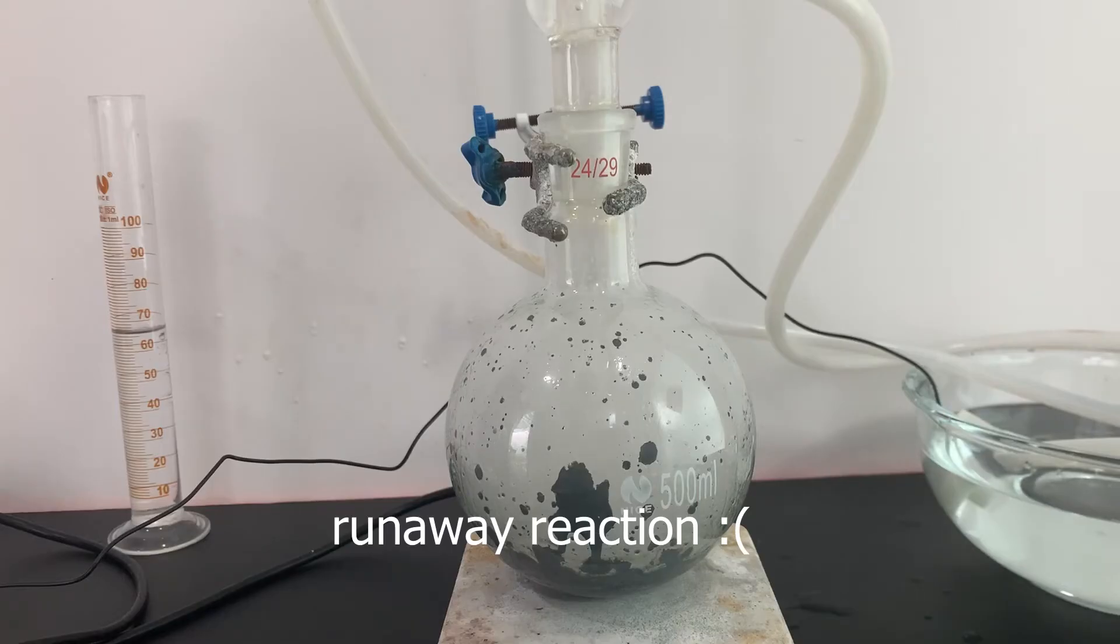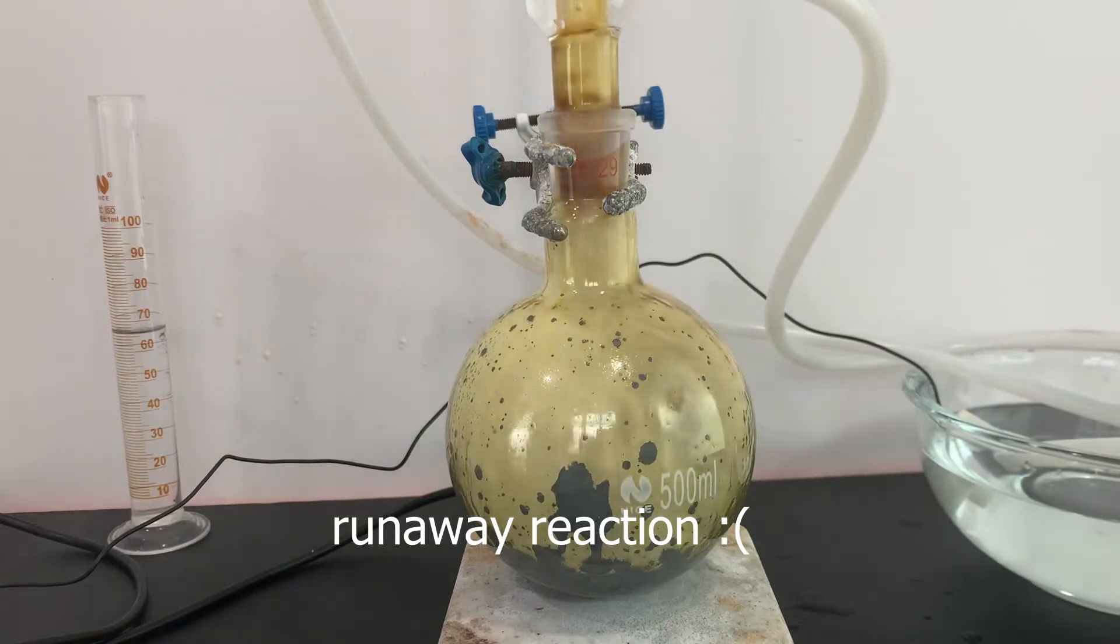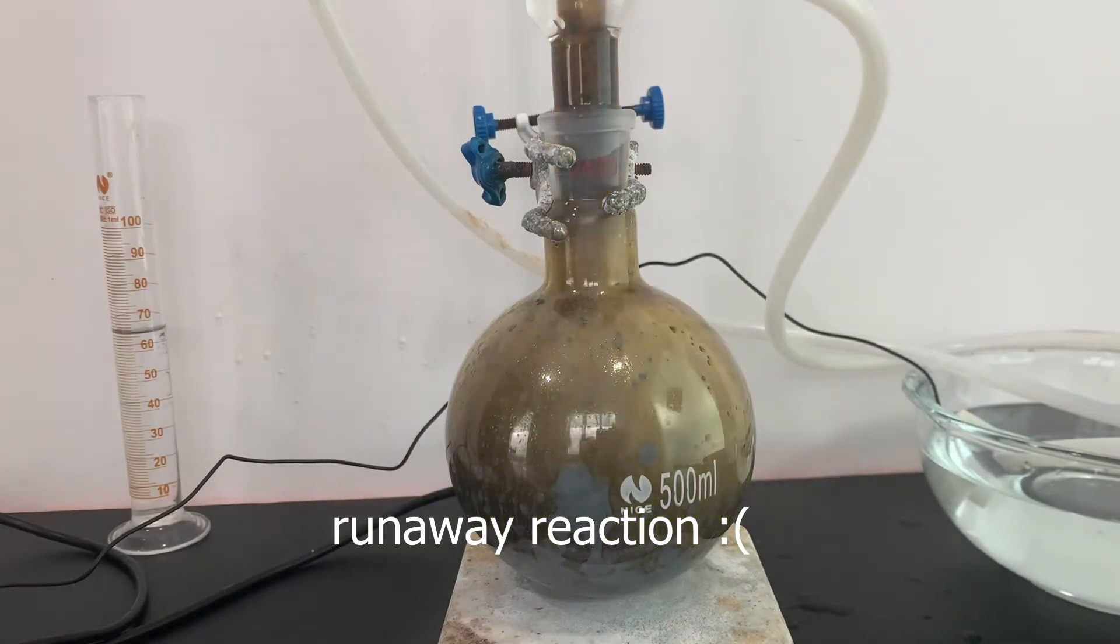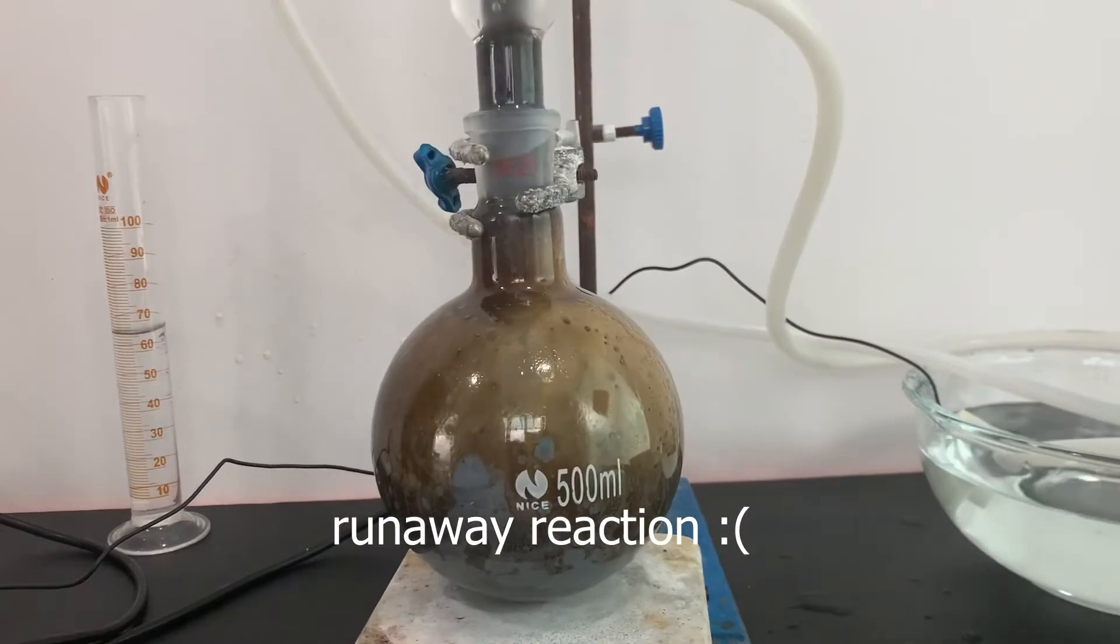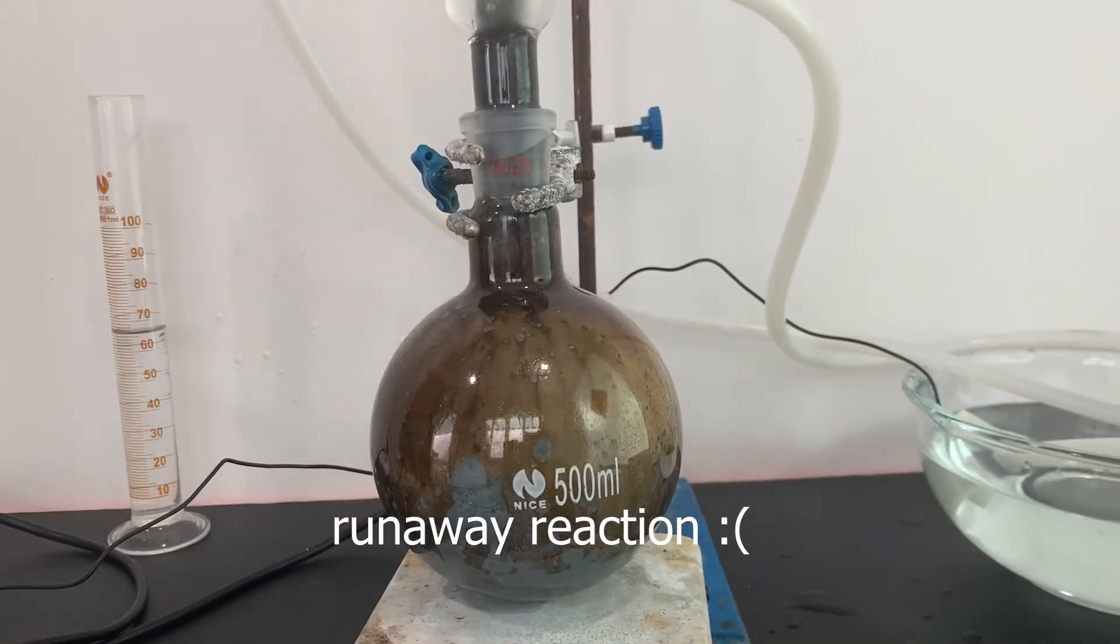I did try and make aniline, but it just doesn't work with powdered zinc nor with zinc granules. Using powdered zinc leads to a runaway reaction, and even if I cool it, I end up with a dark sludge that is impossible to work with for me.